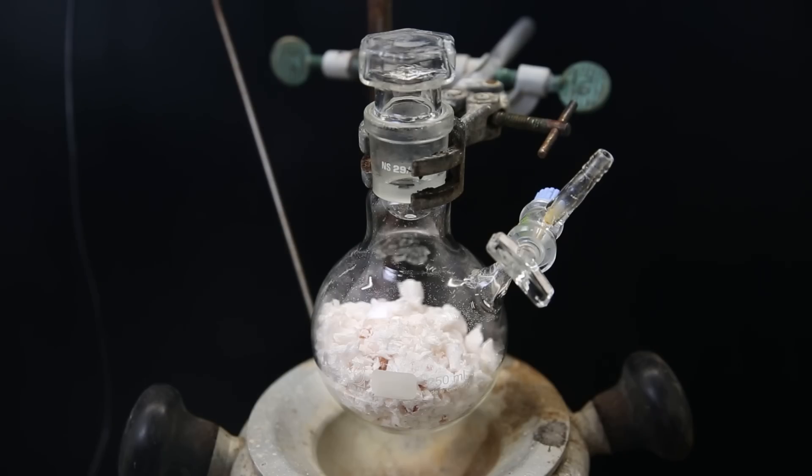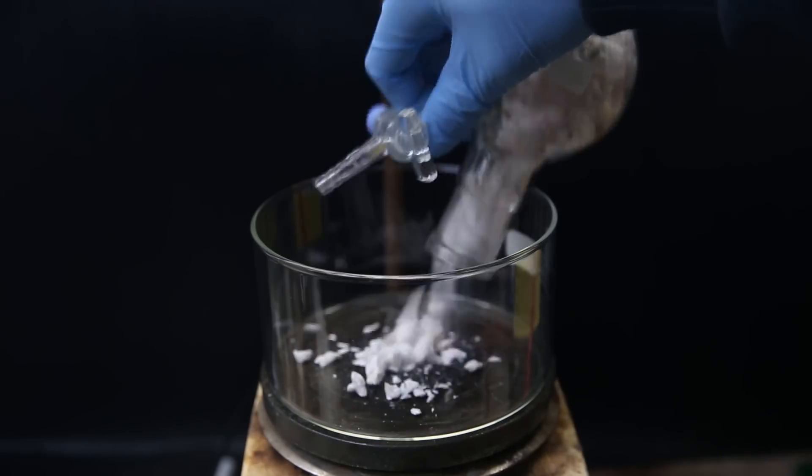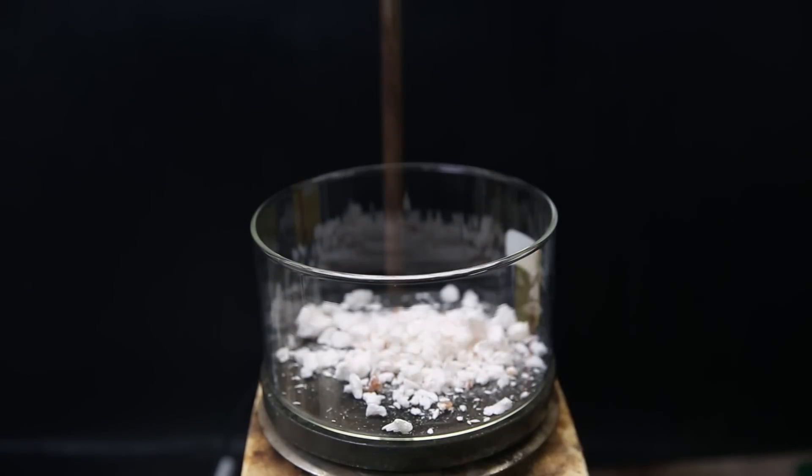When I return, it looks exactly the same, but it should now be dry. I transfer it all to a dish and I can now just pick out most of the orange impurity manually.